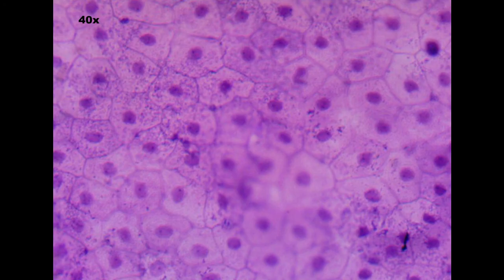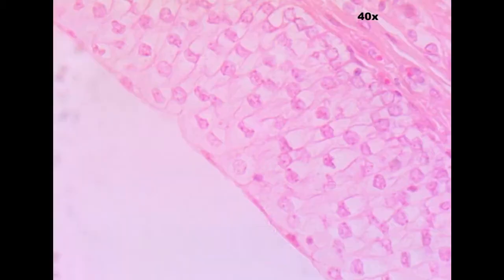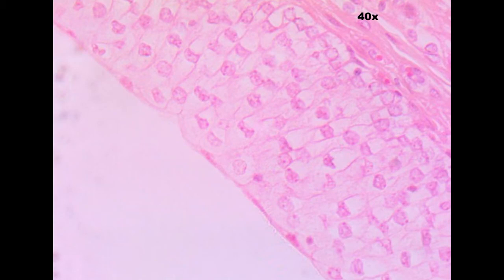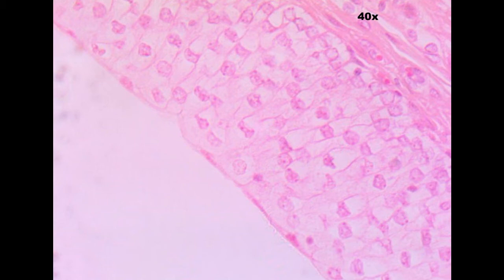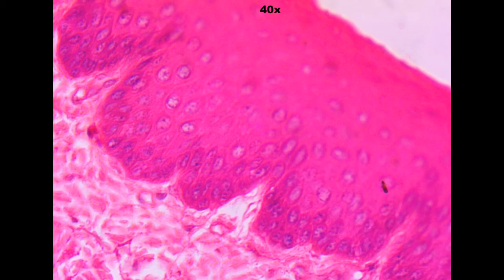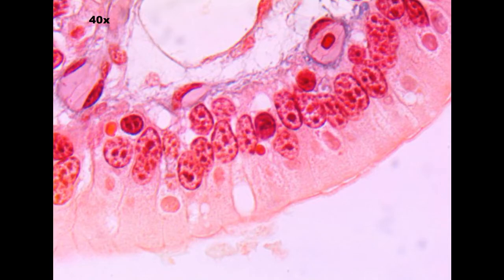Here's our second slide of epithelial tissue — take time to check your key and write your answer down. Here is our third slide, and our fourth slide, our fifth slide, and our sixth slide.